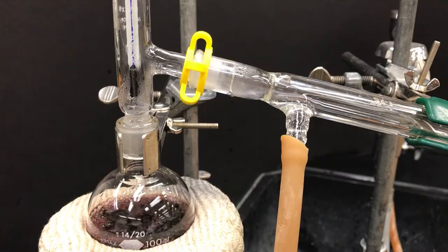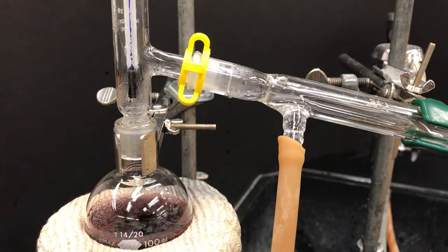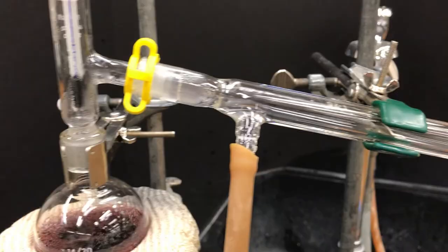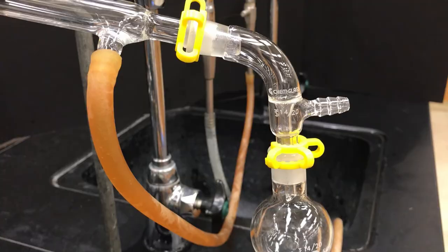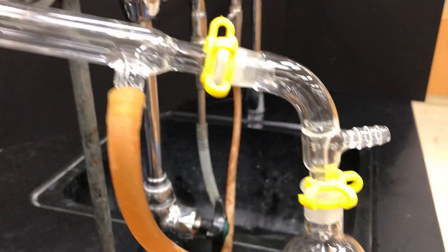Now a lot of stuff is starting to happen—a lot of condensation is happening. If we go off to the right, see what's happening in the receiving flask, you'll notice we have some drips, so that's our distillate. Notice it's clear. Well, that's interesting—we started with a red wine but we ended up distilling something clear.